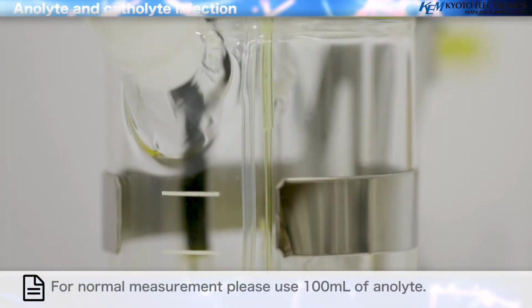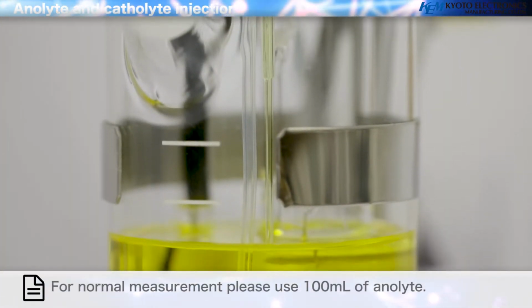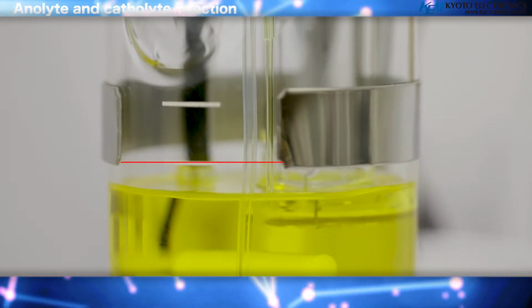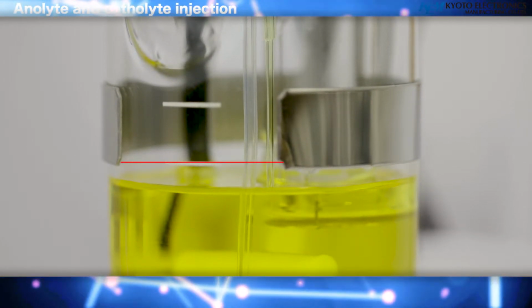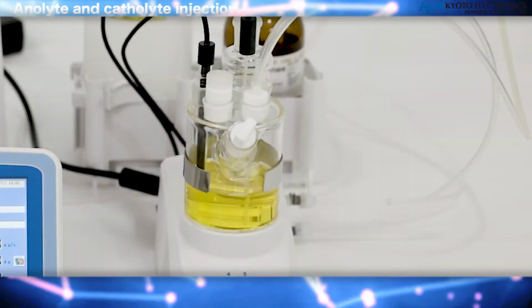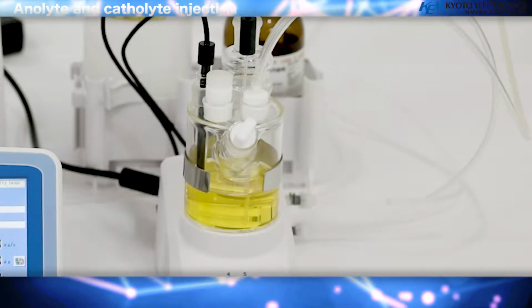For normal measurement, please use 100 milliliters of anolyte. When it reaches the bottom line on the titration cell, you have 100 milliliters. When it reaches the bottom line, push the injection off button and stop the injection.